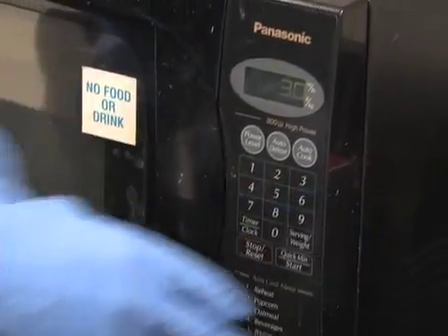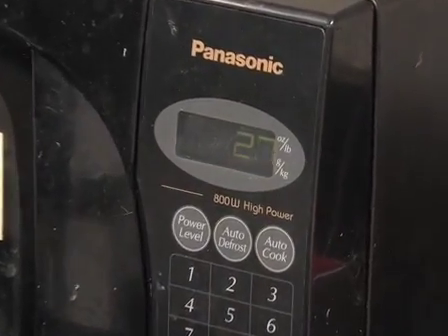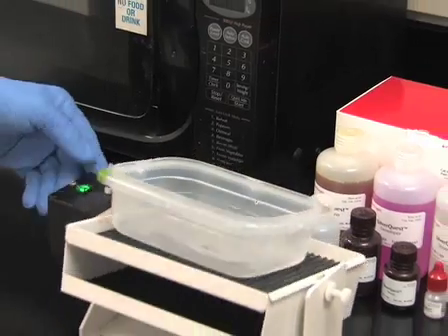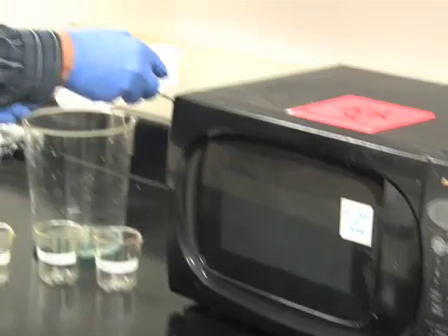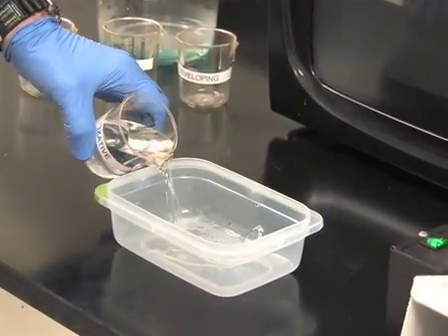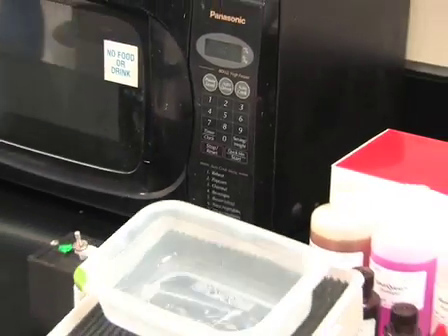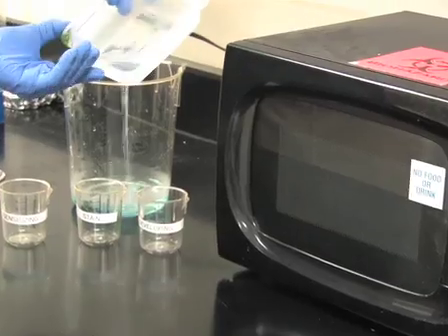The microwave process shortens the necessary incubation steps by accelerating the binding and staining. At this point, place the gel on a shaker and slowly rock for 5 minutes. After 5 minutes, pour off the fixative. Add 100ml of 30% ethanol to wash the gel. Microwave for 30 seconds and then place the gel on a shaker for 5 minutes. After 5 minutes, pour off the ethanol.